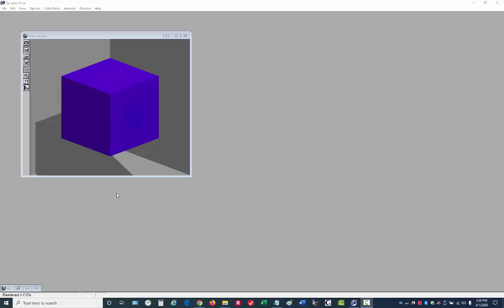I wanted to talk a little bit about some of the pitfalls in working with Slicer. Let's assume that you're able to read in the data and you have the box ready to visualize in Slicer. First thing that you always want to do is under the view, make sure that auto render is checked. This will mean that if you make a change, it will be immediately updated on the screen.